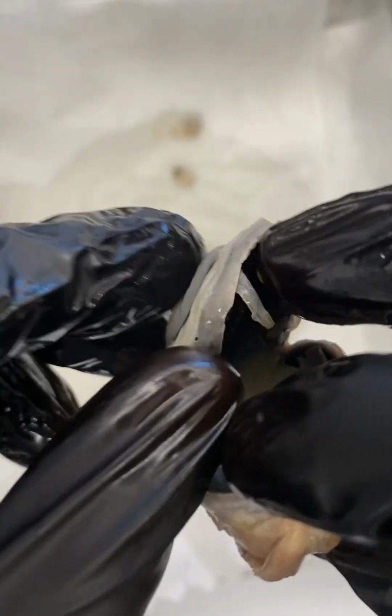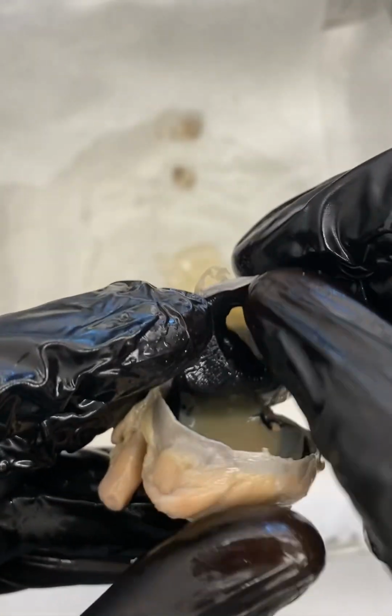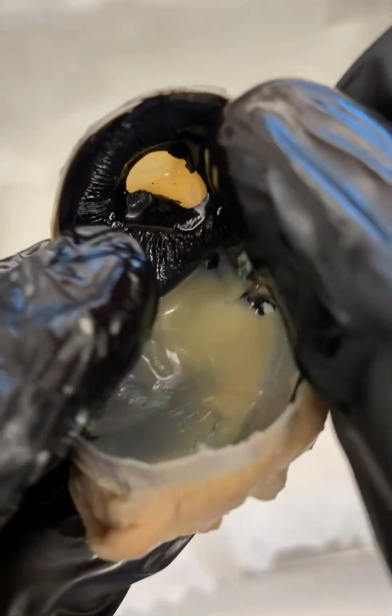Hopefully you can see that window, right? You can see that little opening, right? That's the pupil, okay? So I'm going to try to do this with one hand, but you can see the pupil right there, right? You can see that opening right here where my probe is, and you would be able to puncture and go all the way through that. I don't know if I'm going to be able to do it with just one hand here. But that is our pupil, right?